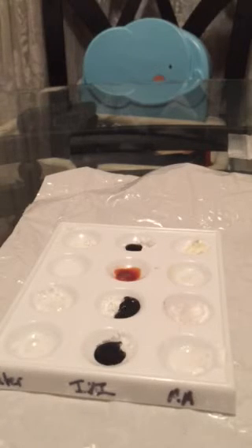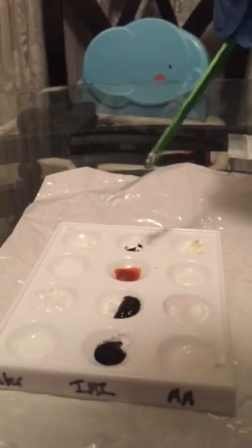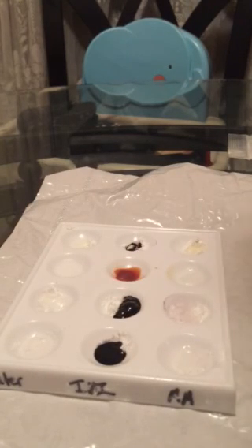See in the IKI that the baking powder is fizzing and bubbling, and so is the unknown substance, whereas the cornstarch is not doing much. Maybe it didn't get on it correctly. The cornstarch is doing a little bubbly and fizzing as well. Yeah, okay, so that is that.